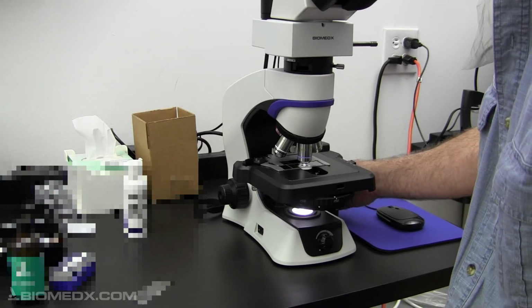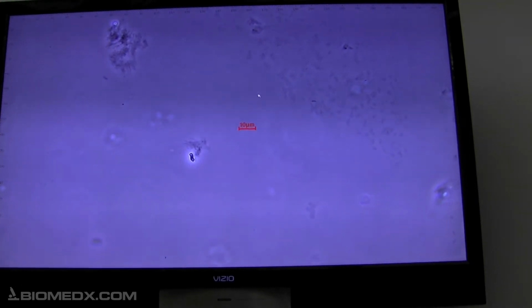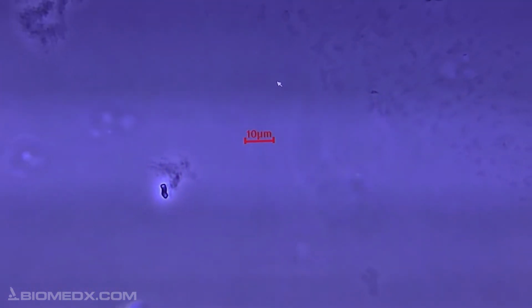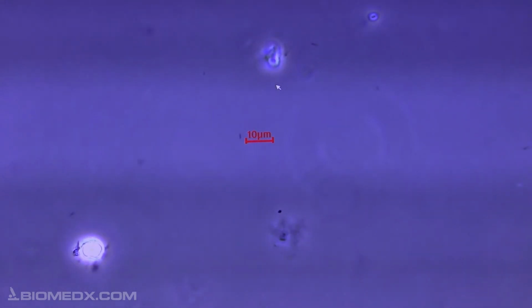Now I'm going to show you, I've got a 47-inch screen, and I'm going to turn the camera to the screen. And there we are. Now, right in the middle there, there's a little 10 micron sizing line. So let me just zoom out again. Because we're recording from the TV, there's a little pattern that might be showing up. But when I first looked at the product, there was some floating material here, and nothing that I would say are liposomes.